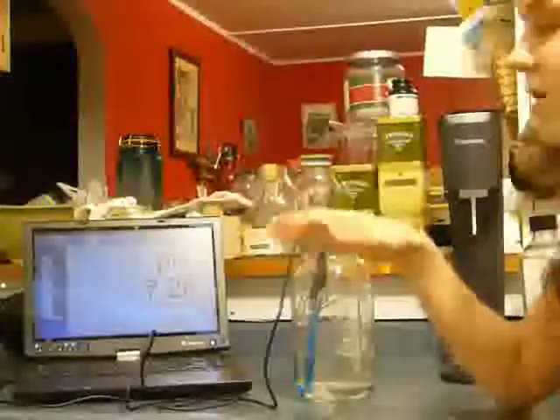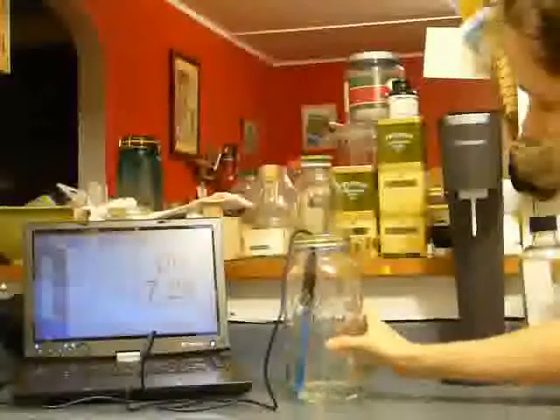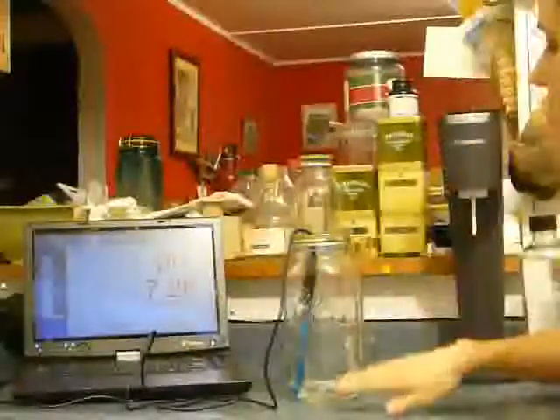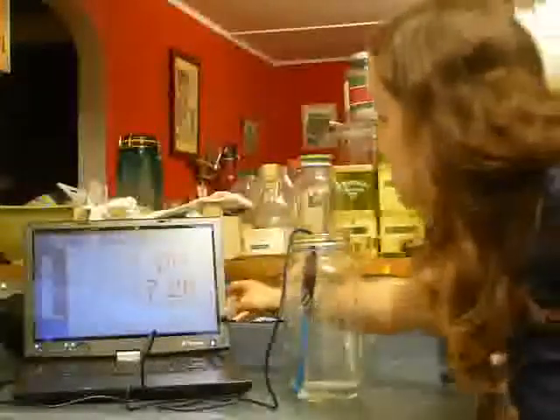And before we start, I want you to notice that I do have a small amount of water in this container, so we can see what our baseline data is. And if you can see here, our pH of the water is much like it was when we started with the last experiment, about 7.2. It's actually exactly 7.29. So let's get some CO2.